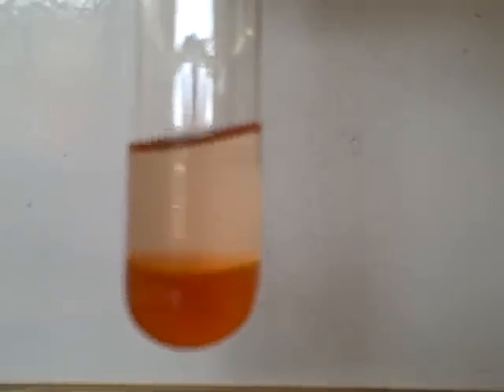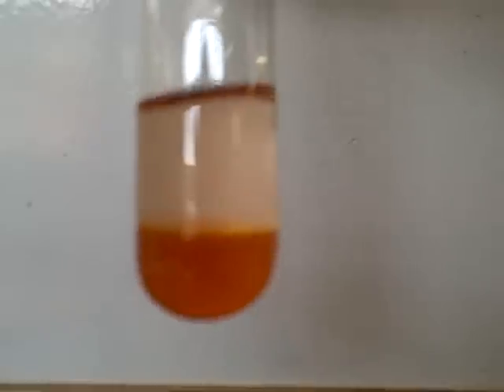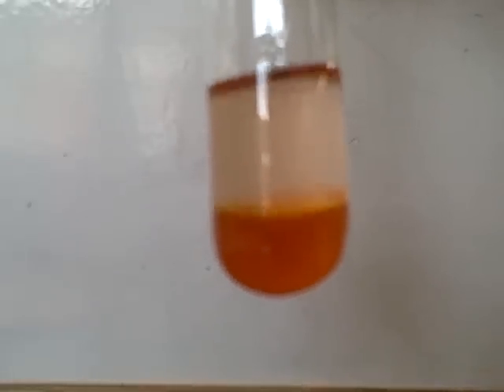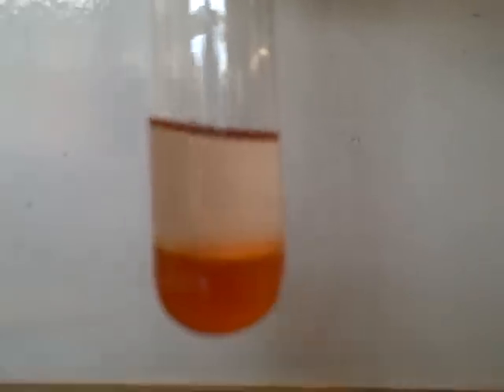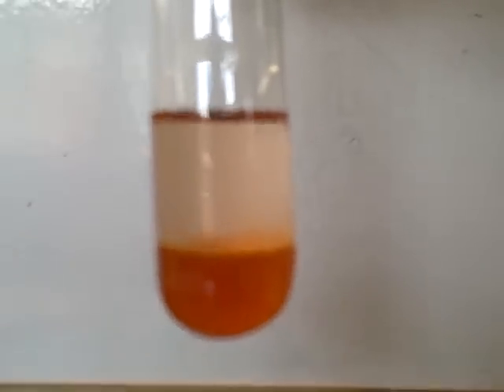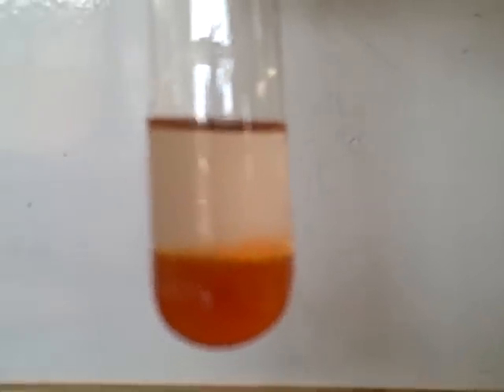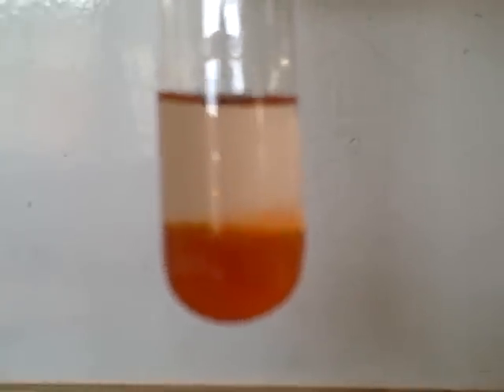For experiment three, I said it was an orangey-red colour. Examiners call that sitting on the fence, and you will never get a mark for that — ever. If you say two colours, even if one is right, you won't get the mark. Pick a colour and stick with it. You can say a shade like deep blue, but don't say more than one colour. I also missed the fact that there are actually two layers — a polar layer and a non-polar layer. I'd have to give the colour of both layers and specify which is on top.